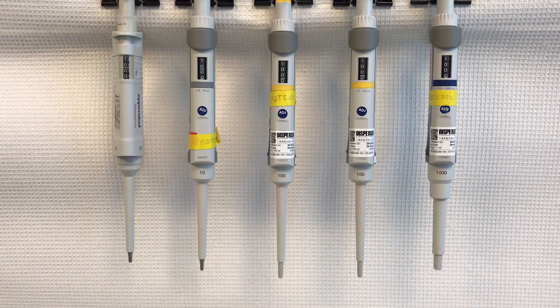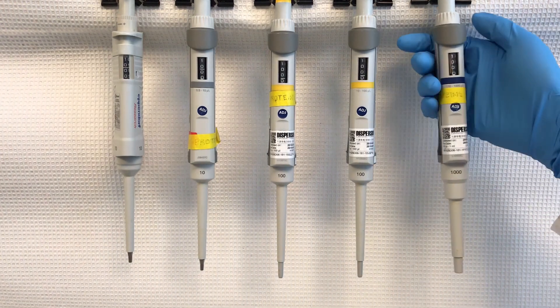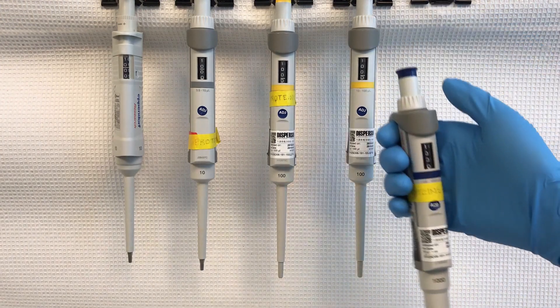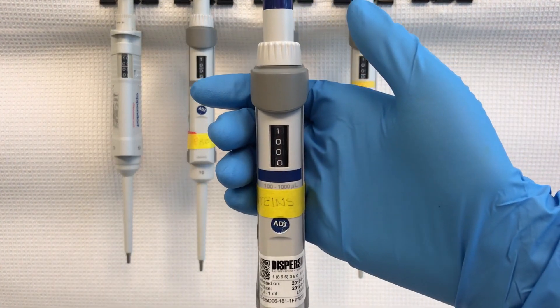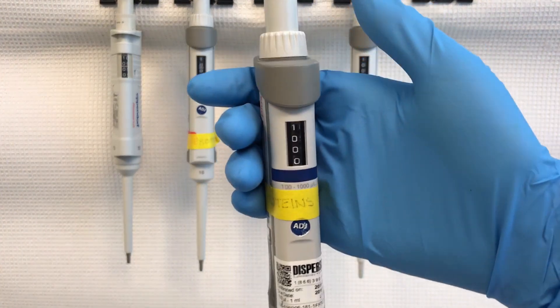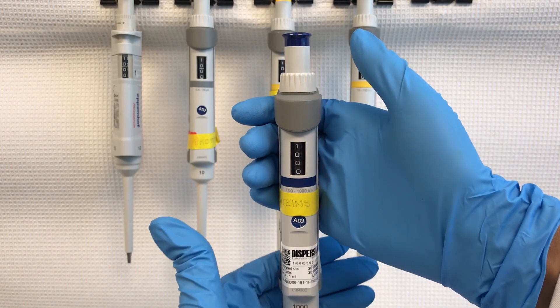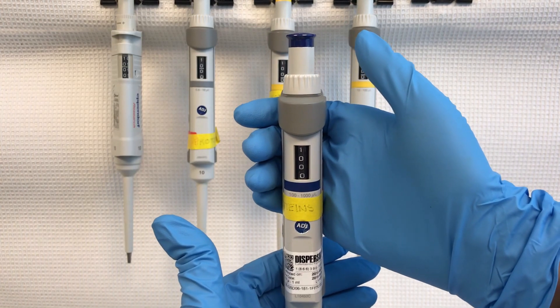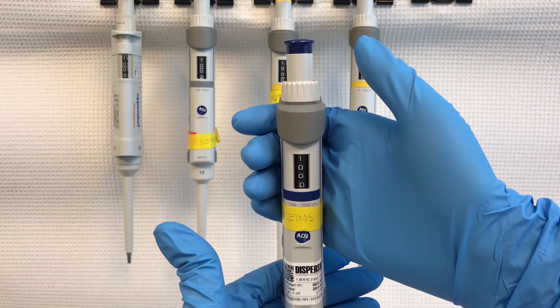The lab's most commonly used pipette is the adjustable single channel micropipette. Thus, this guide will be focused on this pipette. There are three main parts of a pipette.